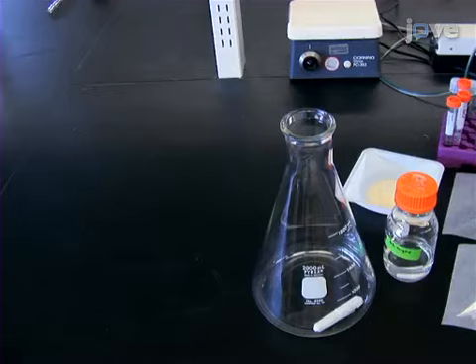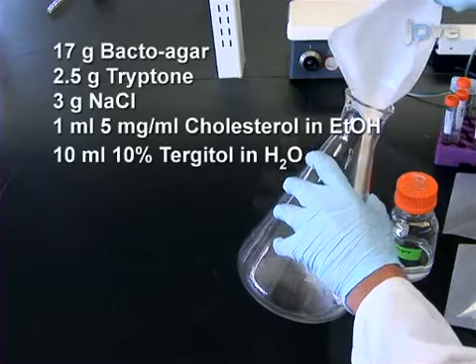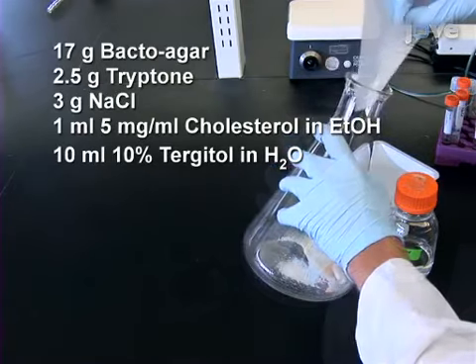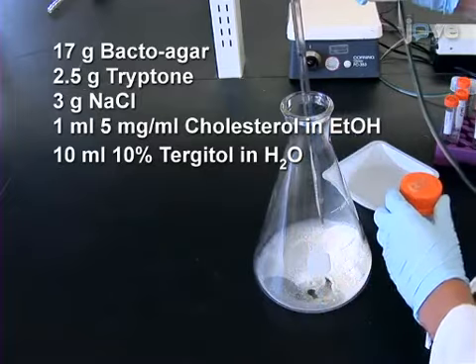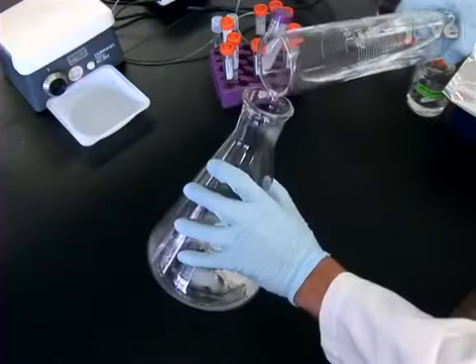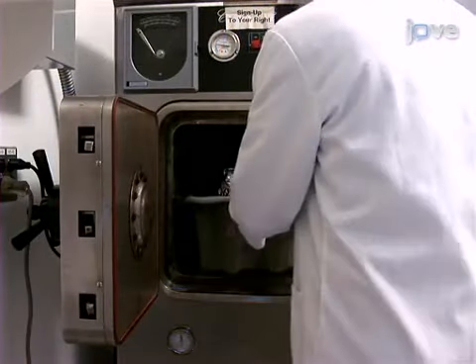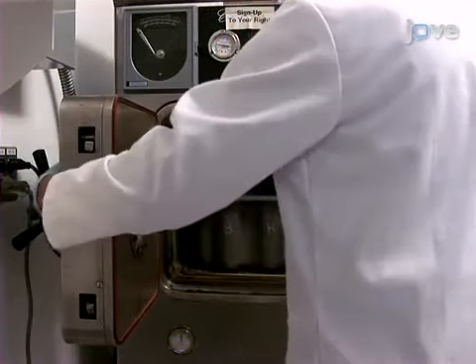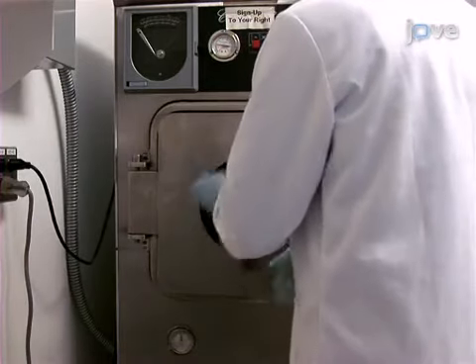To prepare 1 liter of fatty acid supplemented medium, measure out the following components into a flask. Add millipore water up to 800 milliliters and autoclave the medium along with an empty glass bottle for each fatty acid concentration to be tested, as well as appropriate graduated cylinders.